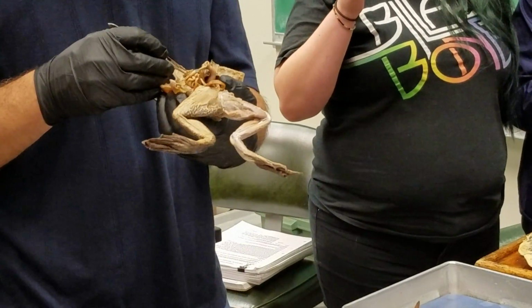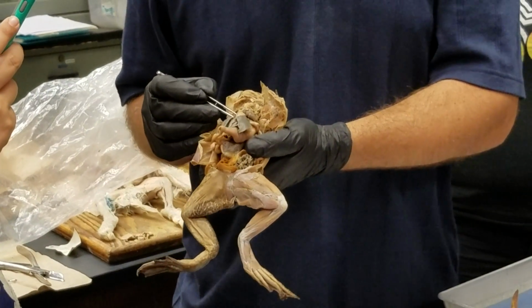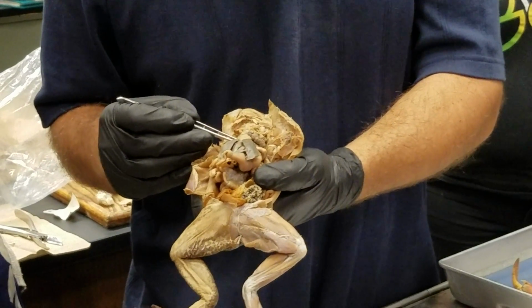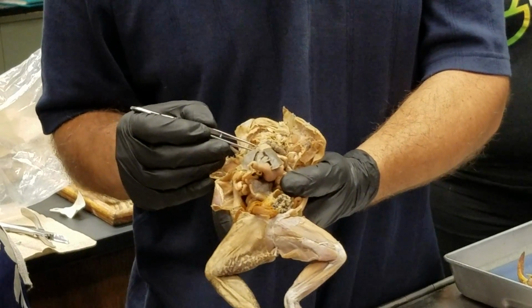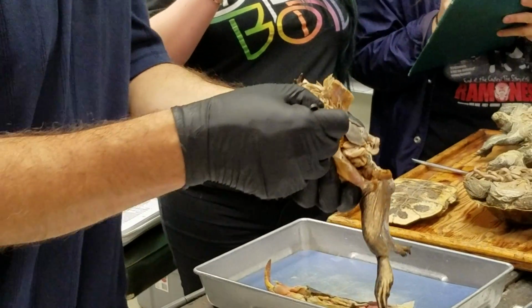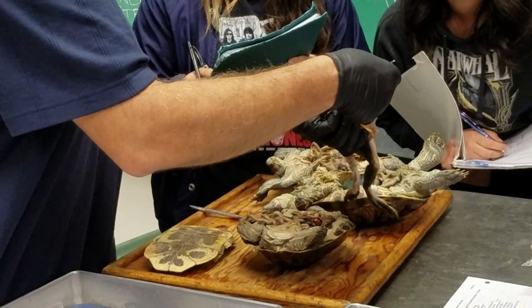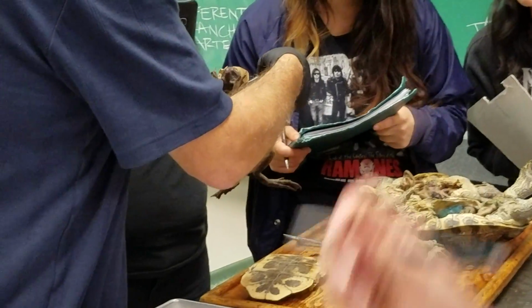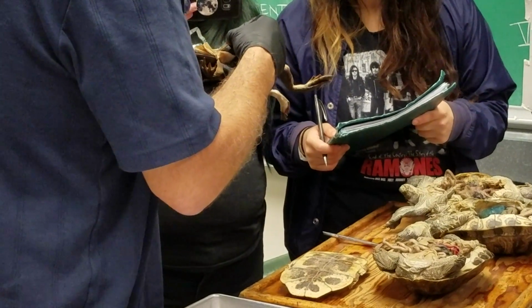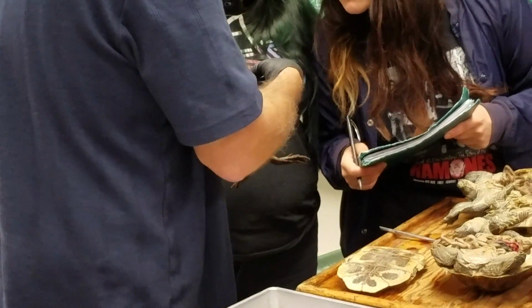So what we see is here the carotid arch coming off, giving rise to internal and external carotid arteries. This is internal and external carotid artery. So this is the carotid arch. And then right behind the carotid arch coming off is the systemic arch. So that would be the fourth aortic arch.